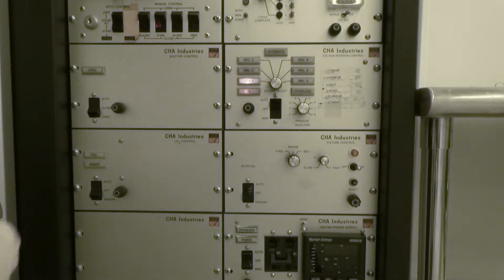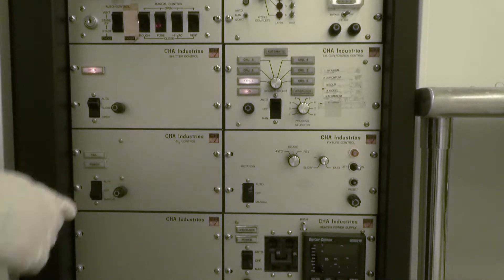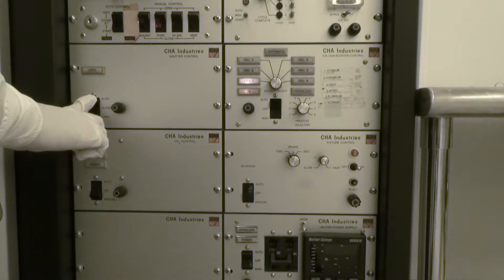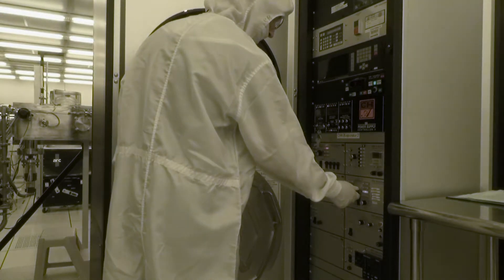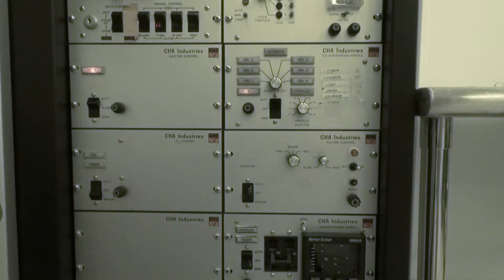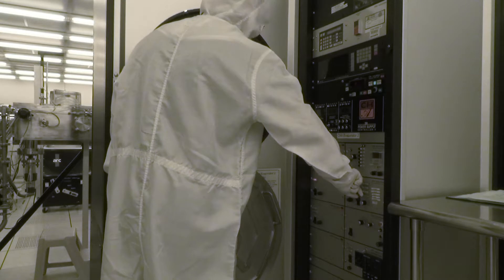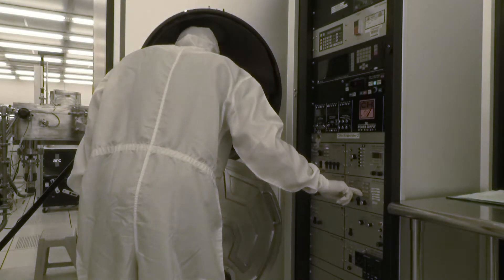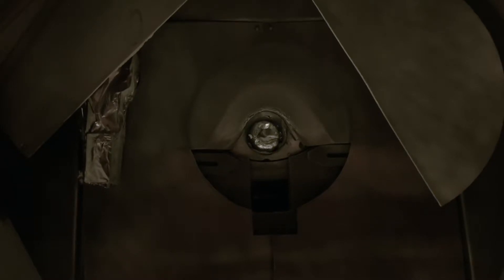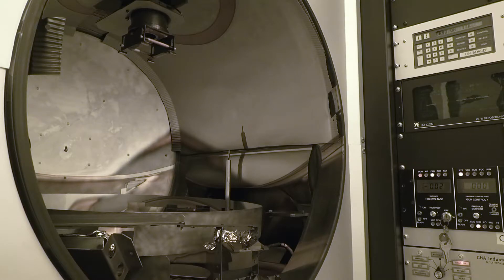At this point, check to see if the shutter is working properly. To do this, switch the shutter control to open. If the shutter is functioning properly, switch it back to automatic when done testing. Now select the metal you'll be using. Turn the source selector knob on the gun rotation control — the rocker switch should be set to manual. Turn the knob to the first metal you'll be using; for this training video, we will be using titanium. When the selected crucible is in position, make sure it is centered in the wedge-shaped exposure area. Check that the viewing mirrors are aligned so you can see the crucible underneath the shutter.